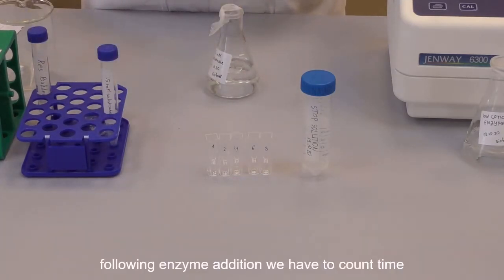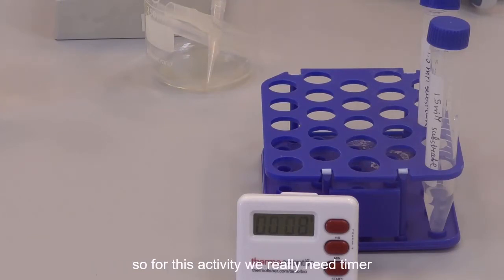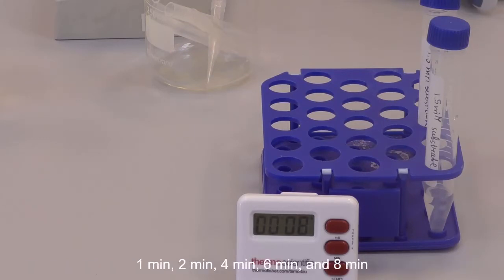Following enzyme addition, we have to count time, because the enzymatic reaction is time sensitive. So for this activity we will need a timer. As we are going to measure the amount of p-nitrophenol formed at 1, 2, 4, 6 and 8 minutes, we are setting the timer for 8 minutes.